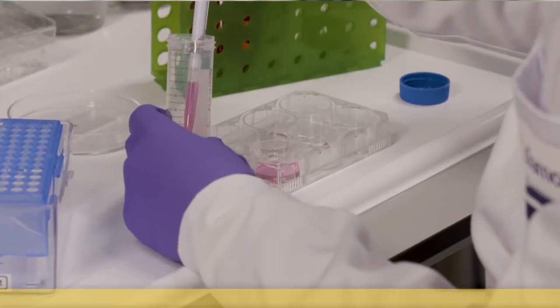The beamline here is one of three in the world that provide this technology, and we use a special kind of x-rays to investigate the ultra structure of cells and look how things are organized inside them.